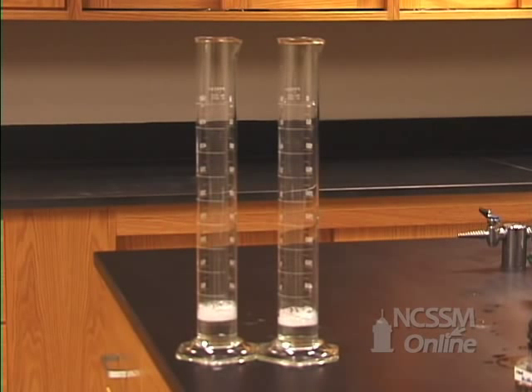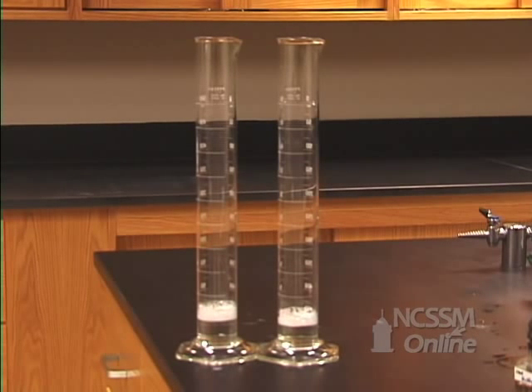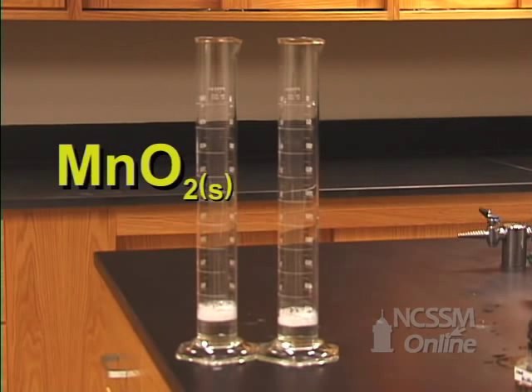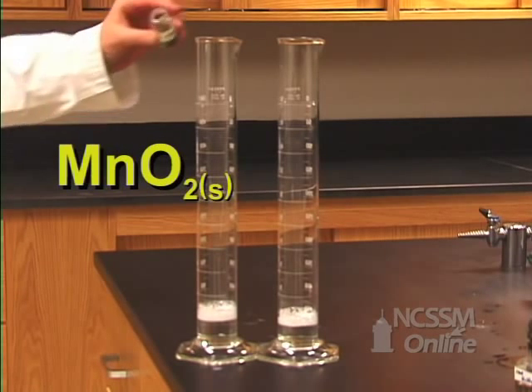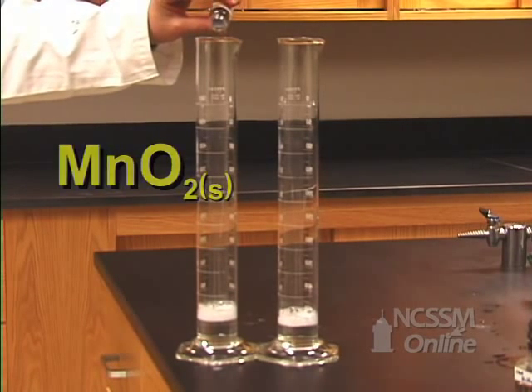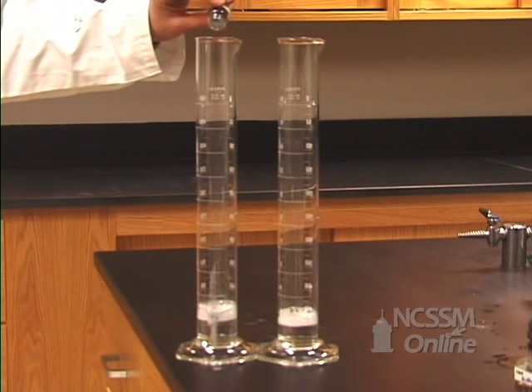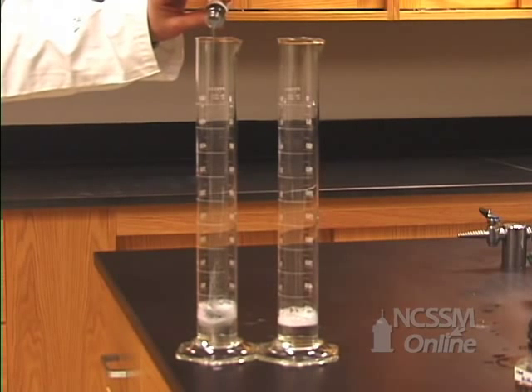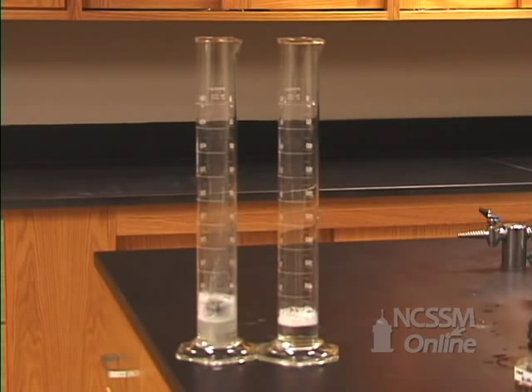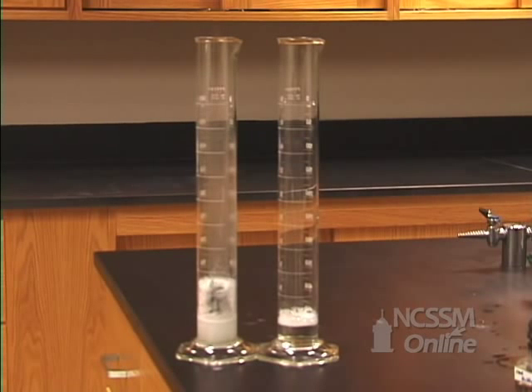Next, I'm going to add some manganese dioxide in the first one. Manganese dioxide is often used as a catalyst. So let's see what happens to the rate at which this reaction occurs.